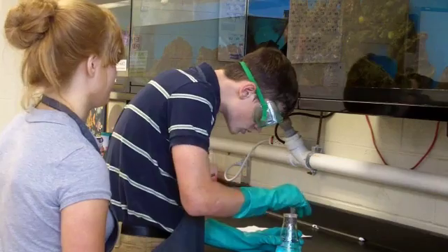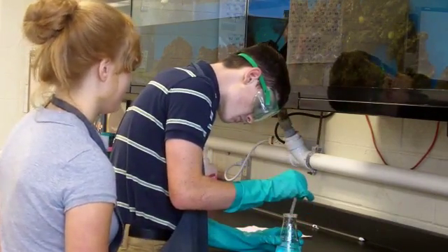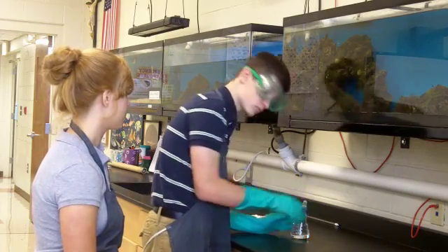Well, I was watching through the window, and everything seemed to be going well. He was using the equipment correctly. She was smiling. Everything seemed to be going right. Then it happened. Ben turned around to read the instructions of the lab and knocked the beaker off the table. There was dead silence.